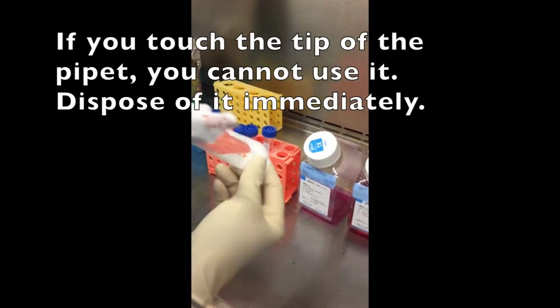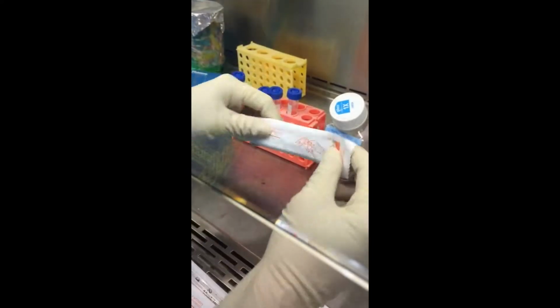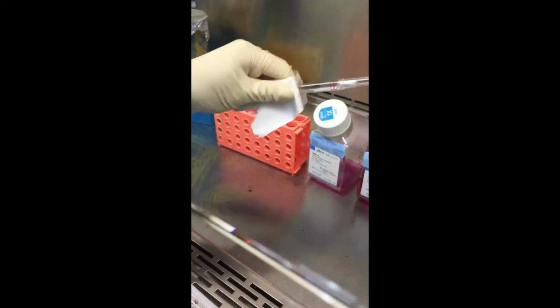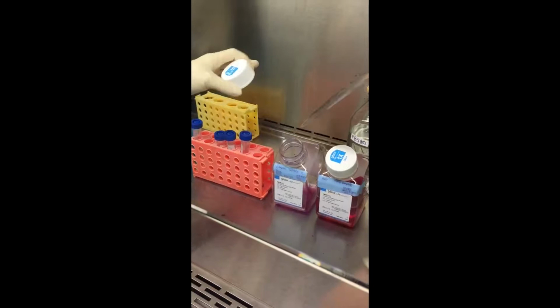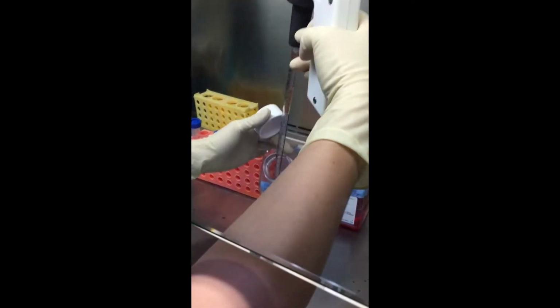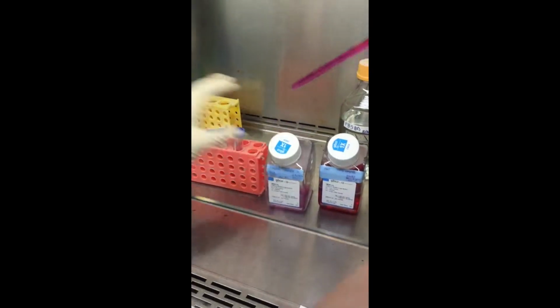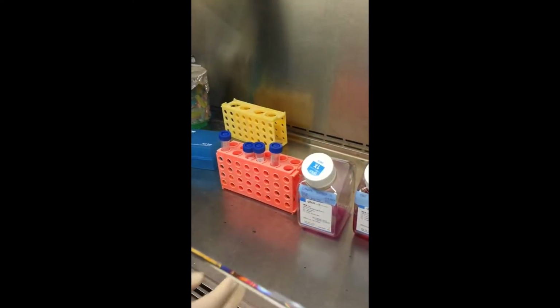That was open the wrong way. Okay, well, we'll just start over. Since that first one was the wrong way, I couldn't use it. I had to dispose of it. There we go, because you can't touch the tip. So I'm going to put 8 milliliters of media in each of my tubes. My tubes are already labeled. That was the untreated.